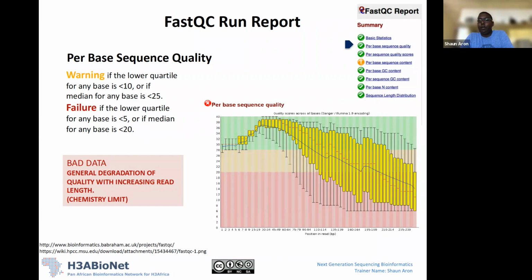So this is where it becomes a bit tricky on assessing your data. Obviously you don't want to just throw data out, but what we can do is try and clean up data in a way whereby, if we still wanted to save this particular sample, we might say, okay, I can cut the read at around 110. I'm going to have shorter reads. Depending on what you're trying to do with the reads, that is going to affect your downstream analysis. So you need to weigh up what the effect is on your downstream analysis by cutting the read, or whether it's worthwhile just to remove the sample completely. Those are the things that you do need to consider if you want to clean up your data.